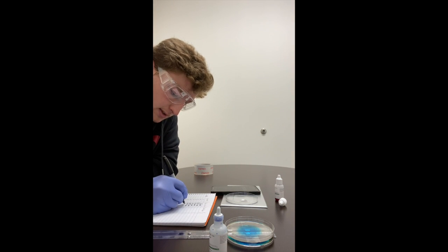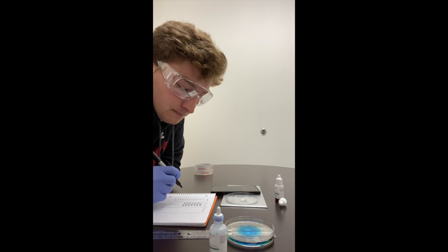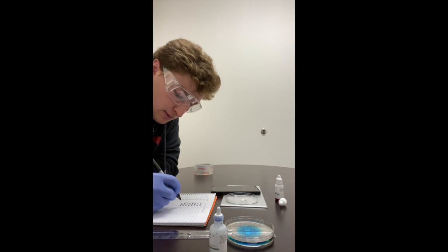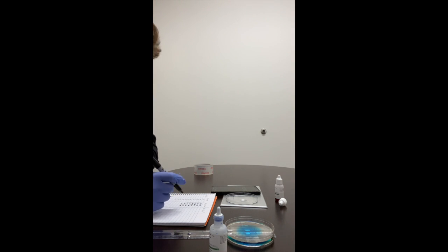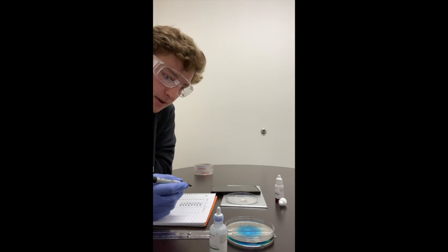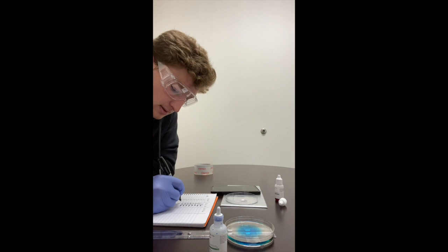At 70 seconds, 6.5 centimeters. At 80 seconds, 6.5 centimeters. And we started at 4 centimeters, so this is only traveling 1.5 centimeters. And at 90 seconds, it's still at 6.5.